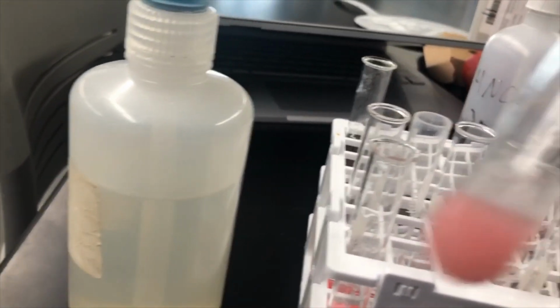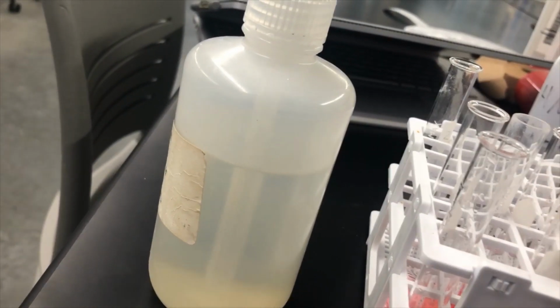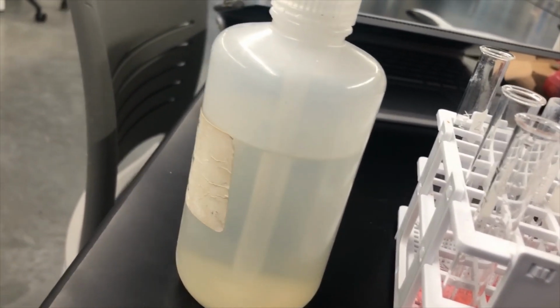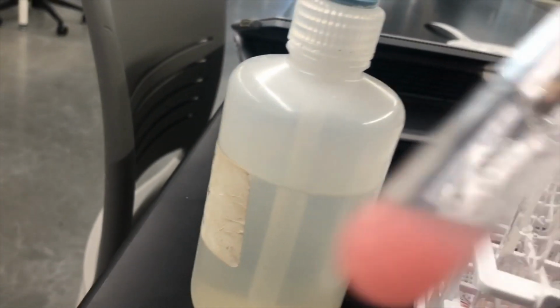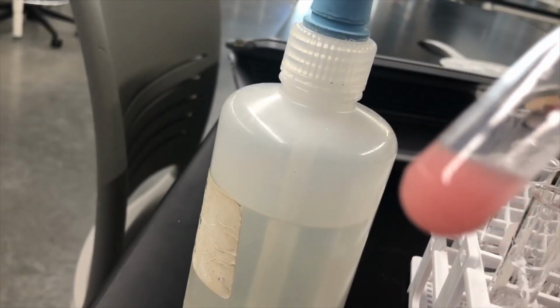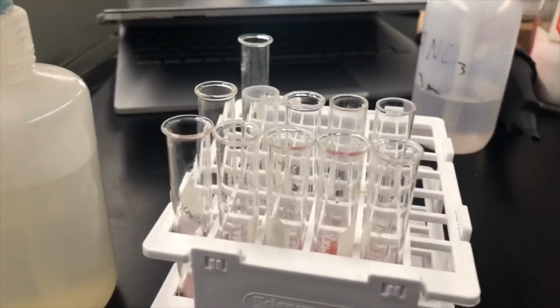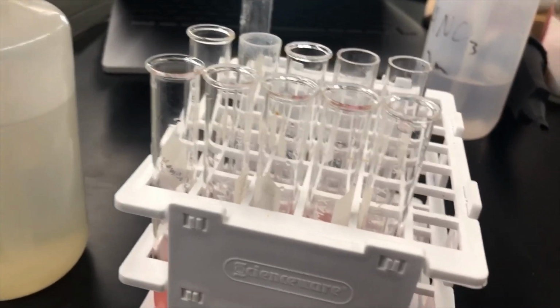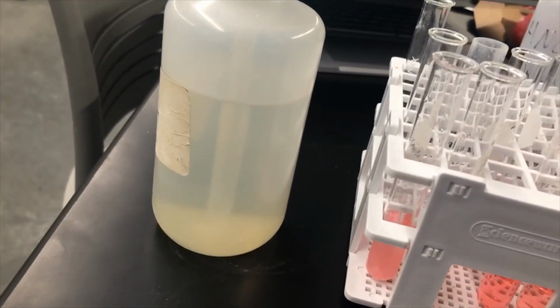Whereas this guy, it's now super dark, and if you swirl it around, you can actually kind of see some solid in there. I don't know if you can see that dark pink spot. Try to find it. Just take my word for it, there's some solids in there. So with the barium chloride, which remember was soluble, we do see solid precipitate form.